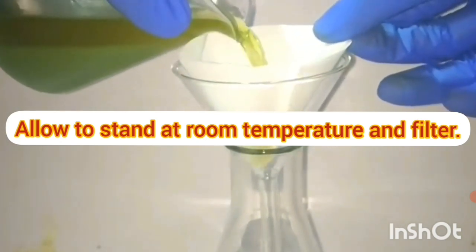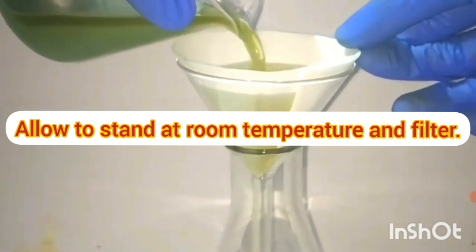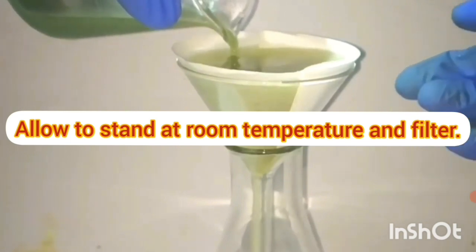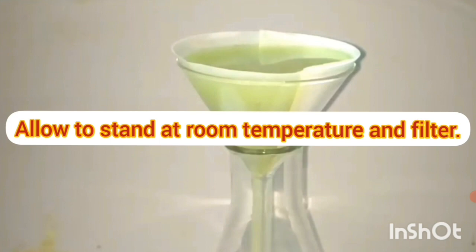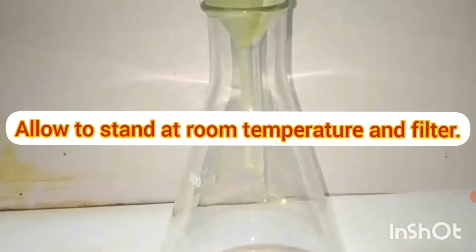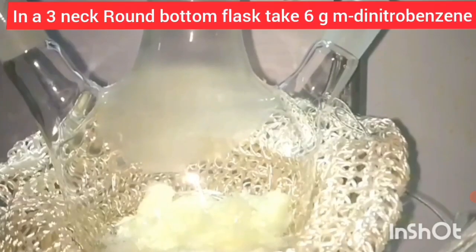After filtration, we will get the residue and the filtrate. Discard the residue, which contains Na₂CO₃. The filtrate contains NaSH, which can be used as a reducing agent for the reduction of M-dinitrobenzene to get our product, M-nitroaniline.